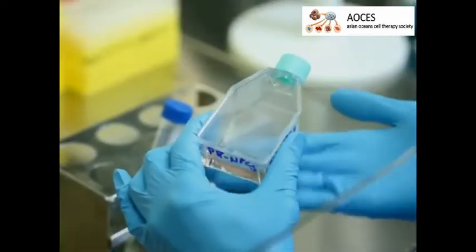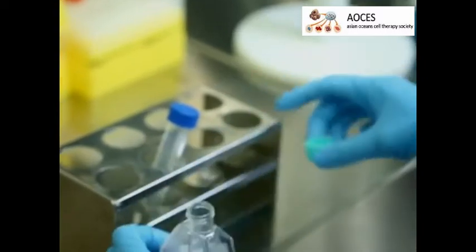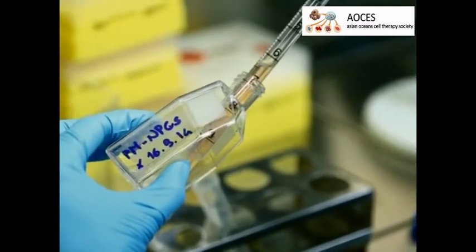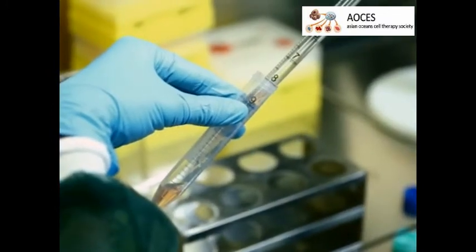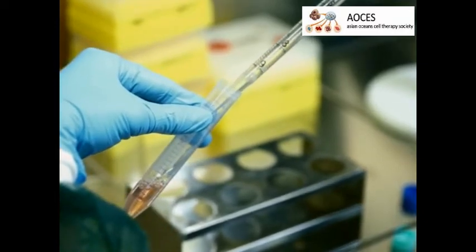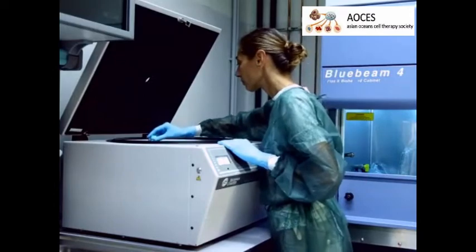Beginning with neural stem cells that meet the criteria as described in the text protocol, re-suspend the cells to a concentration of 1×10⁶ cells per 150 microliters. Prepare at least 1.2×10⁶ cells per mouse to have enough cells for loading the pipette. With neural stem cell medium, wash the cells 3 times in a 10 milliliter conical vial, spinning at 500×g for 5 minutes at room temperature to pellet the cells after each wash.